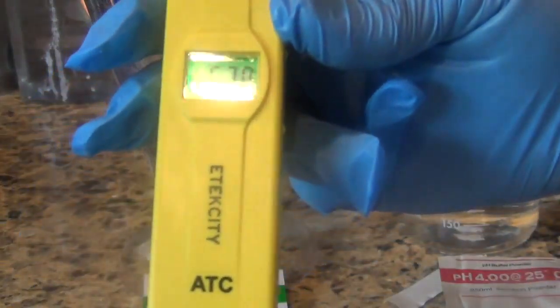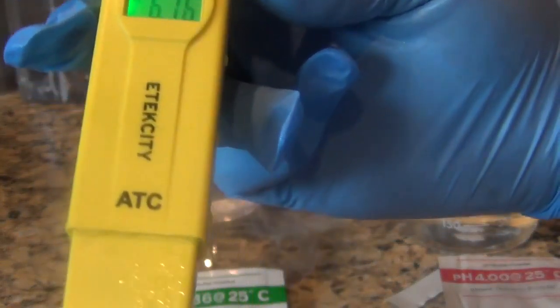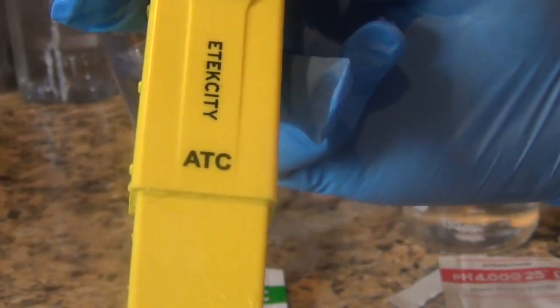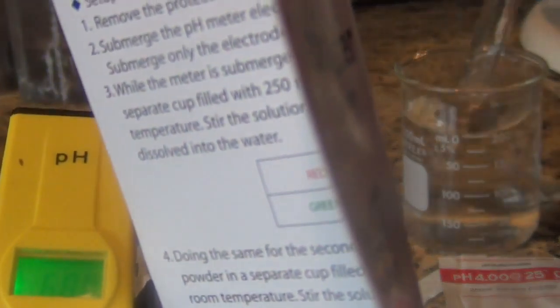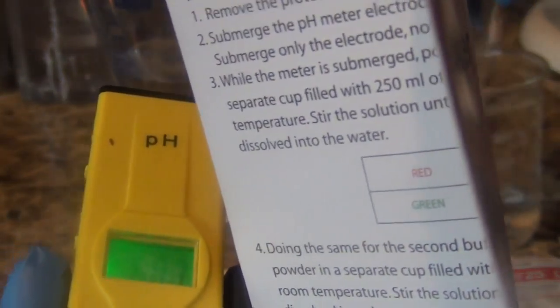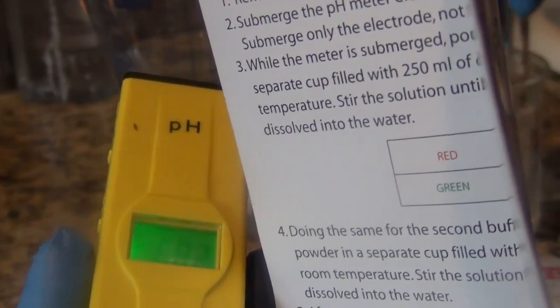Wait for it to stop a little bit. If you do this you have to make sure that you've dissolved all of the buffer powder. And sometimes it takes quite a few stirs.